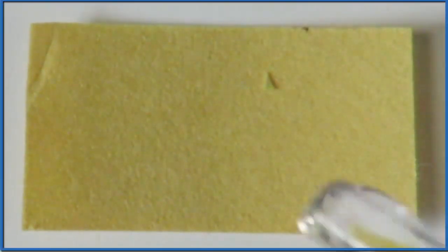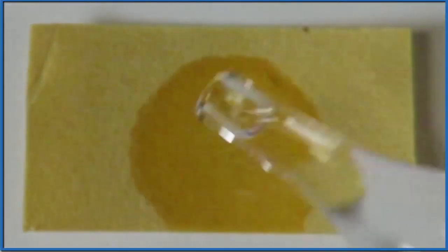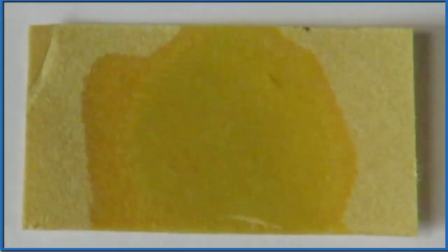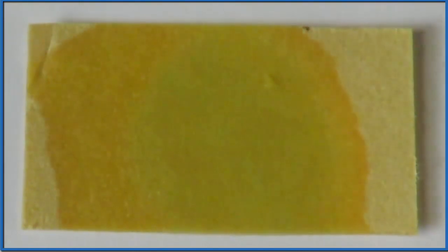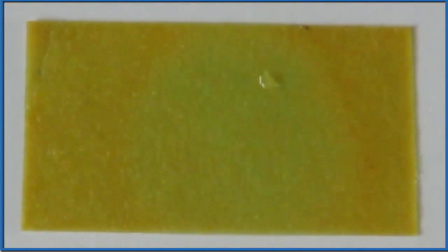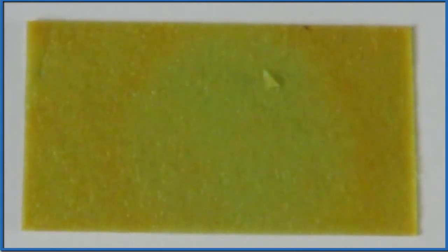So we have a piece of pH paper here, and we're going to put a strong acid and a strong base on it. First, let's put some distilled water, pH of 7. Nothing really happens.